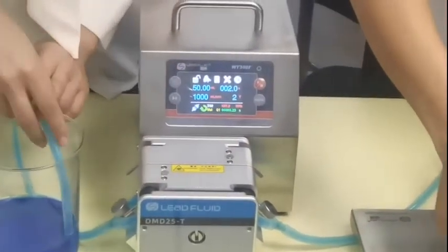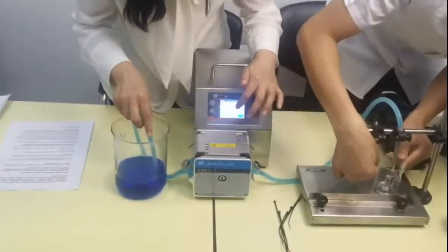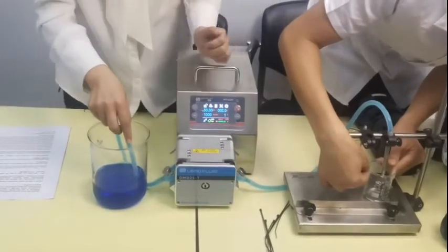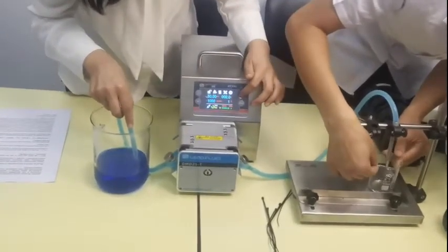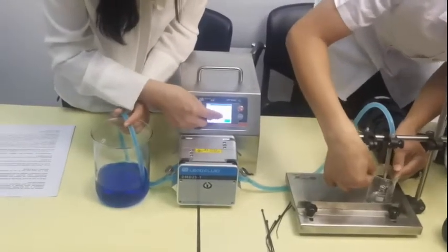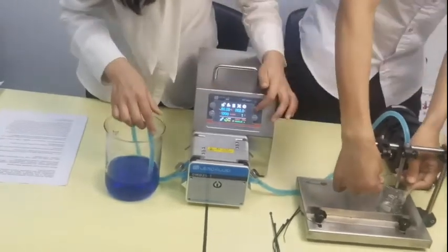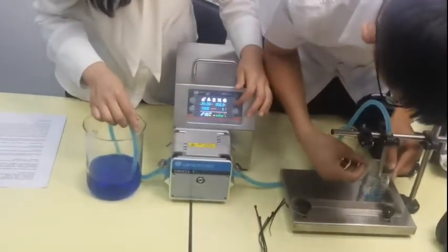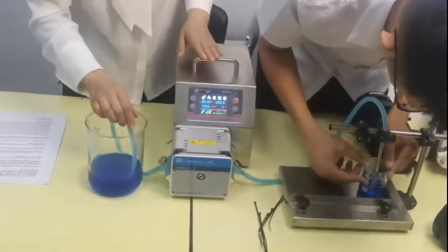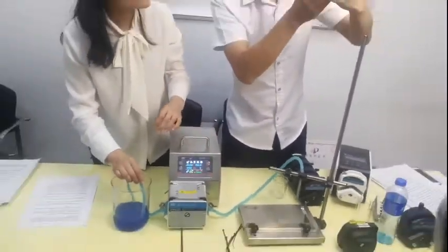Return. Test — use one bottle. Let's start. Maybe we test 60. Yes, we change to 60. Okay, 60. That's good. Accuracy.